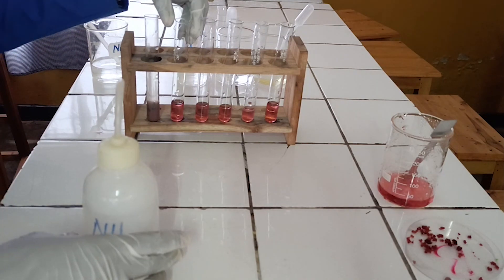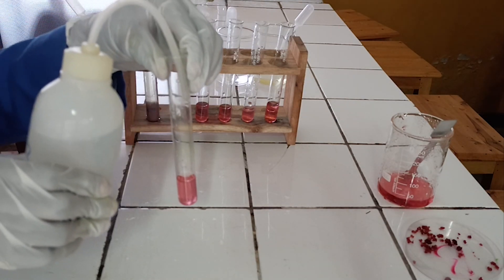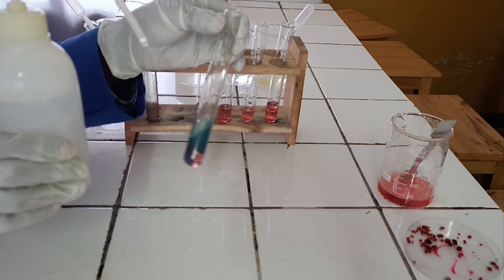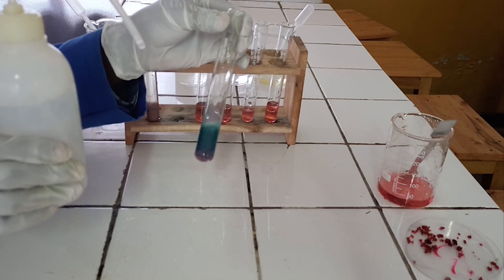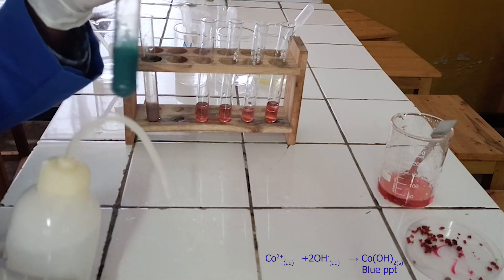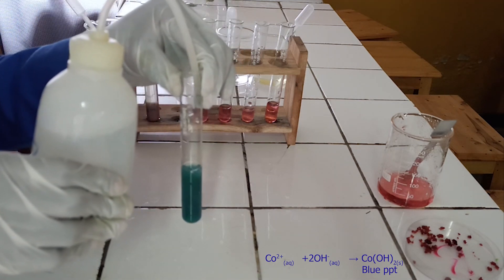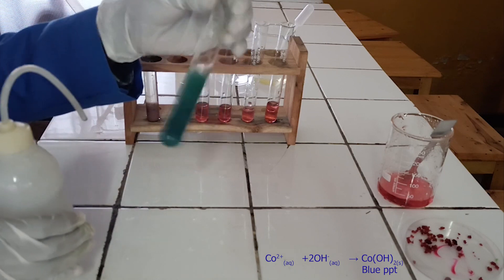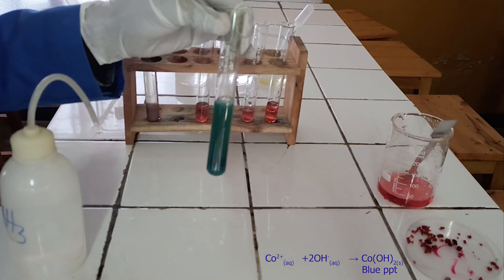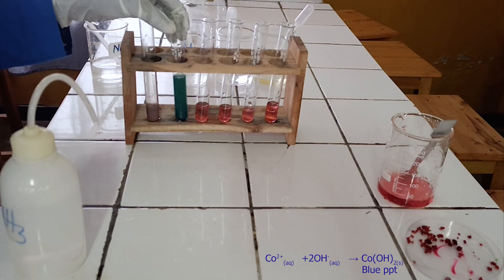To the second test tube, add ammonia solution dropwise until in excess. As you see, ammonia reacts with cobalt-2 ion to form a blue precipitate. In excess of ammonia, the blue precipitate turns to a deep red-brown solution. Below there is the ionic equation for this reaction.